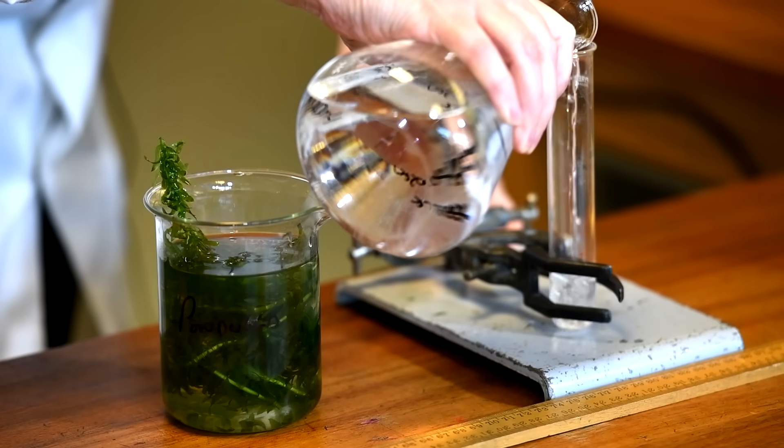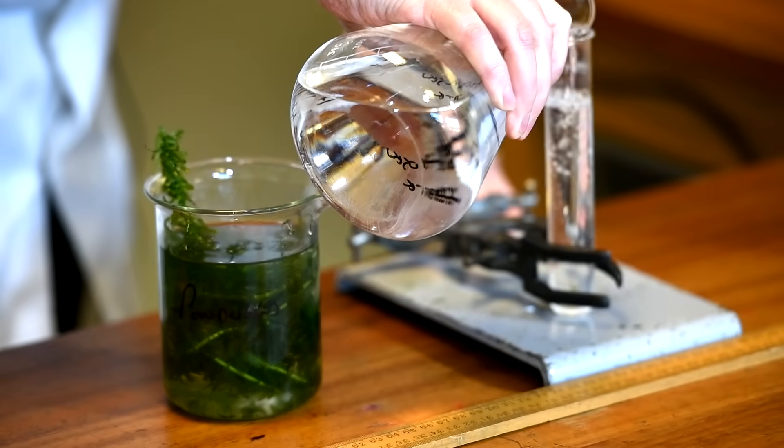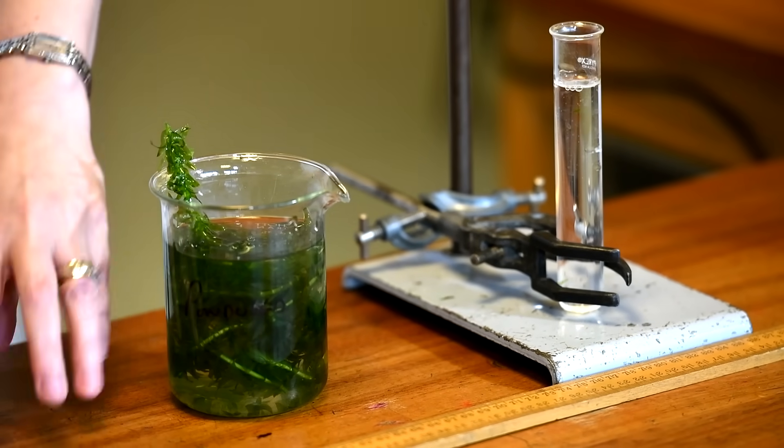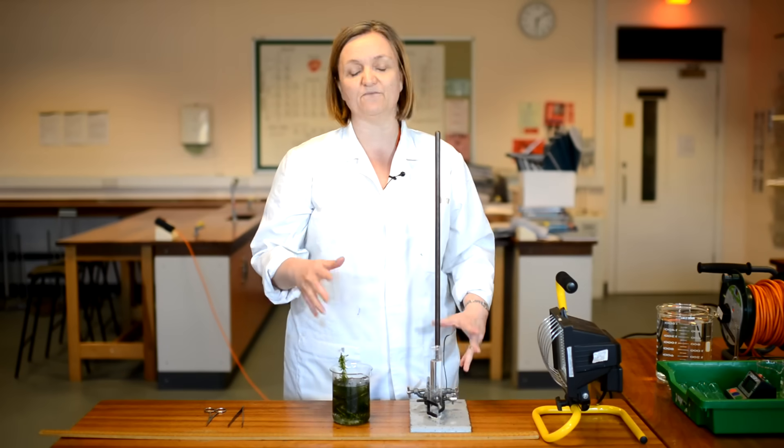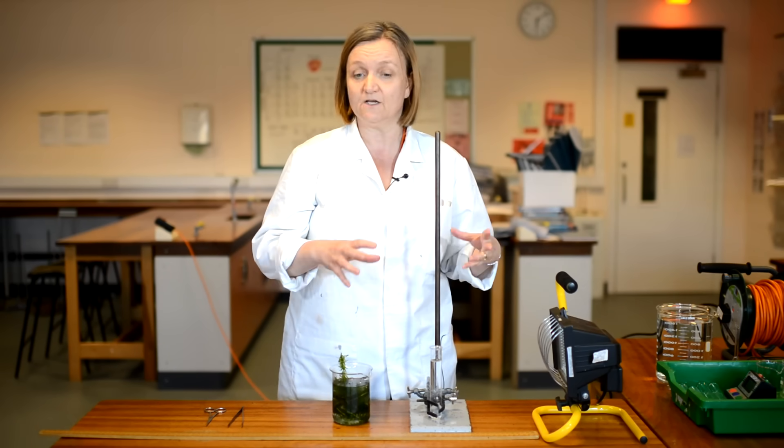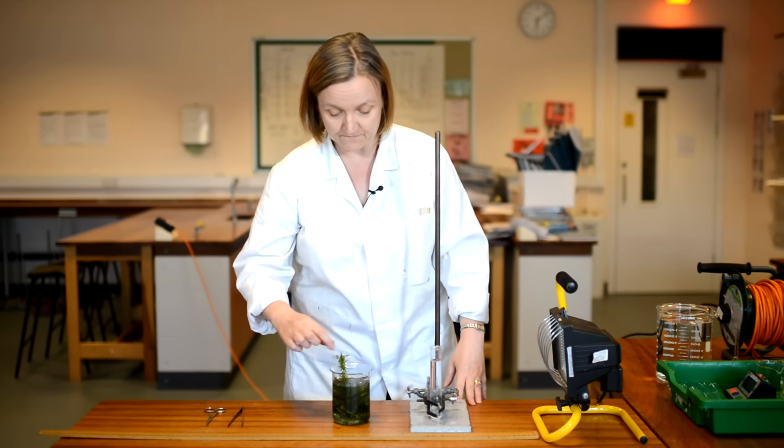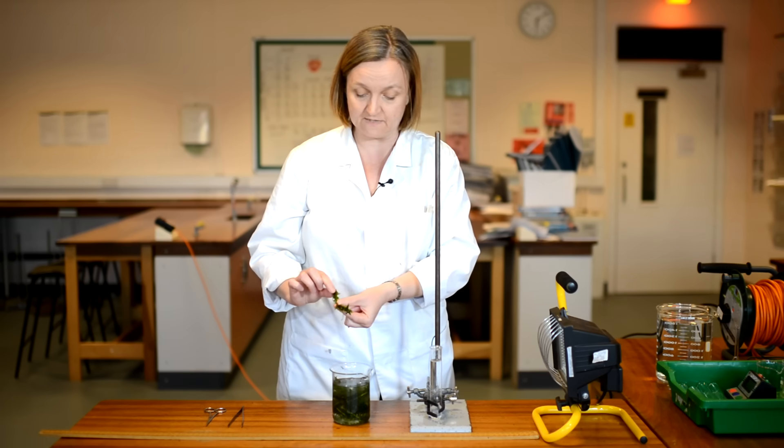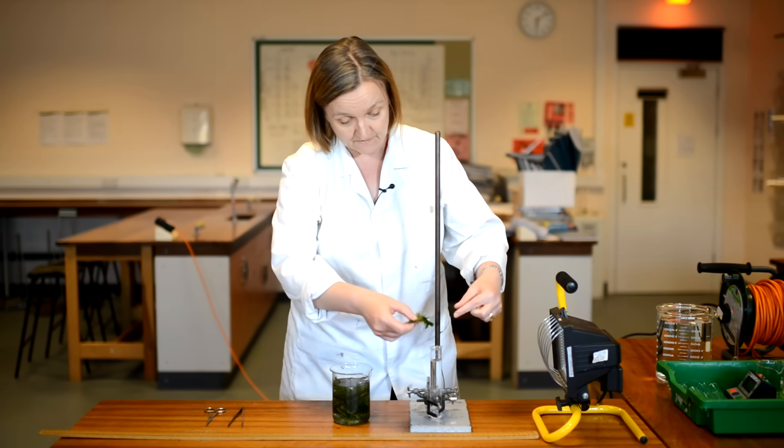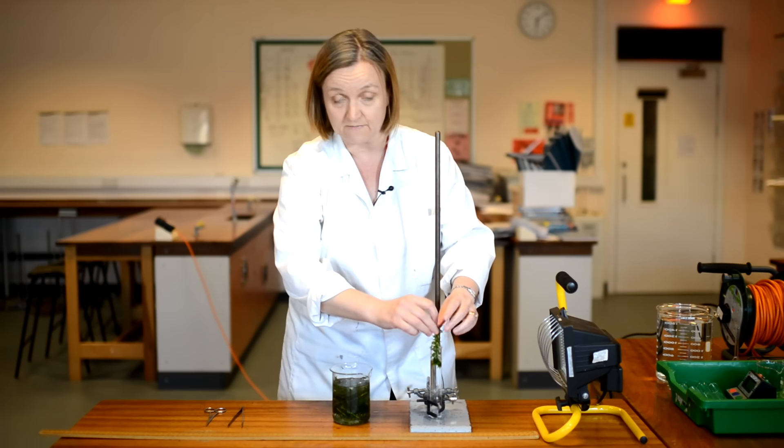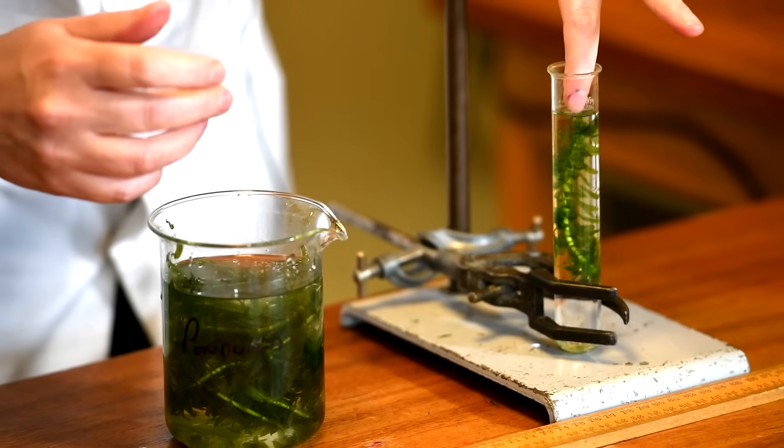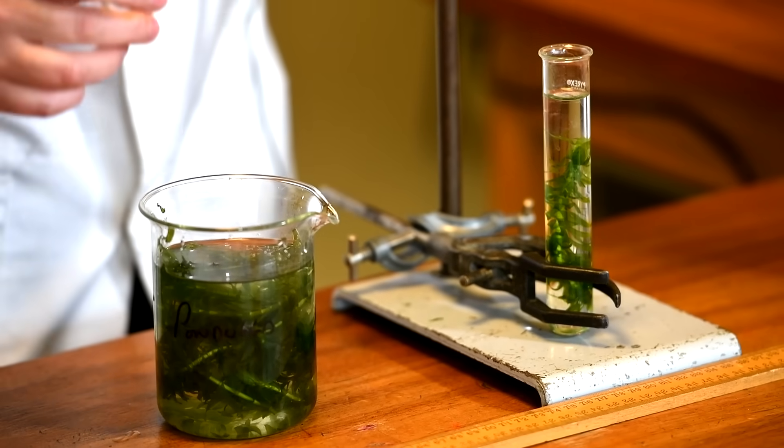Now, I've clamped my boiling tube so that you can see inside the tube nice and clearly. But in the school lab, you may have used a test tube holder to hold your test tube. But I've just clamped mine today. So I've got a nice size piece of pond weed here. And I'm going to pop it inside my sodium hydrogen carbonate solution. And I'm going to make sure it's right below the level.